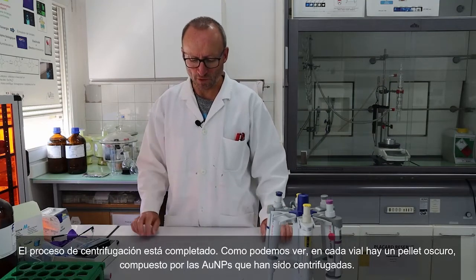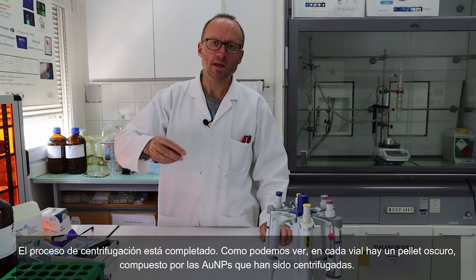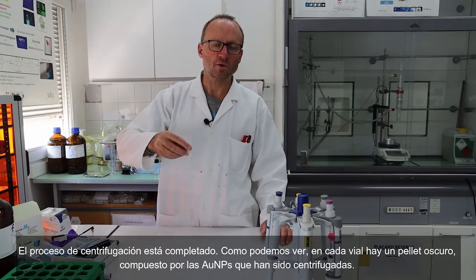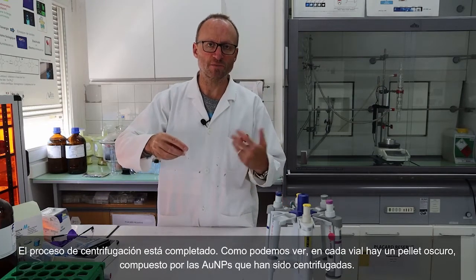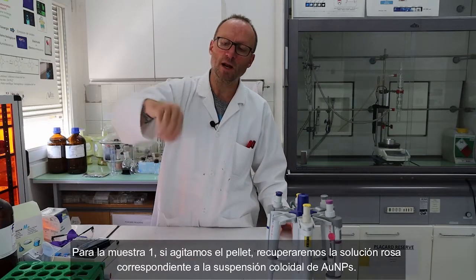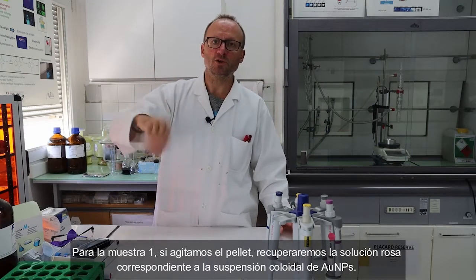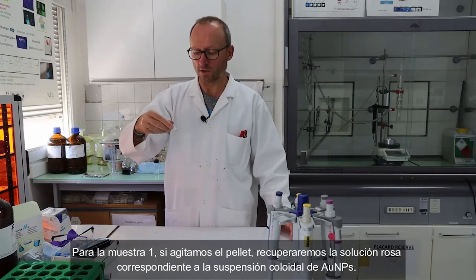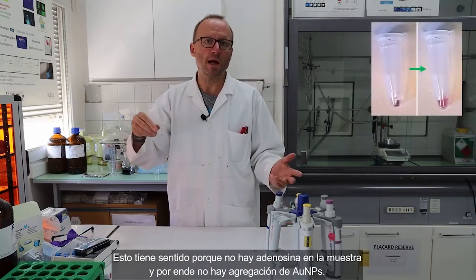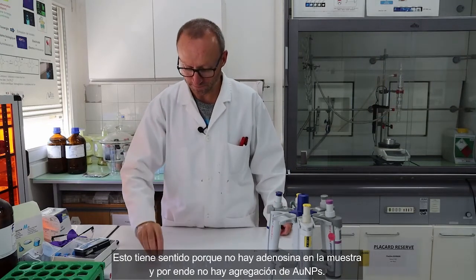So the centrifugation step is done. We recover the samples. As you can see, in each of them, there is a dark pellet, which is made of the nanoparticles which have been centrifuged. For sample 1, if I shake this pellet, then I recover the pink solution corresponding to the colloidal suspension of gold nanoparticles. Okay, it makes sense because there's no adenosine, so there's no aggregation of the nanoparticles.